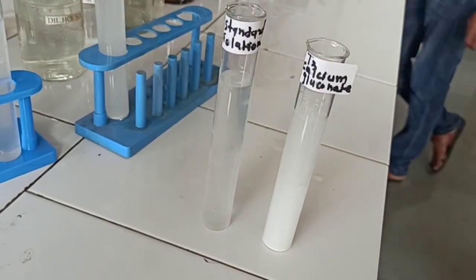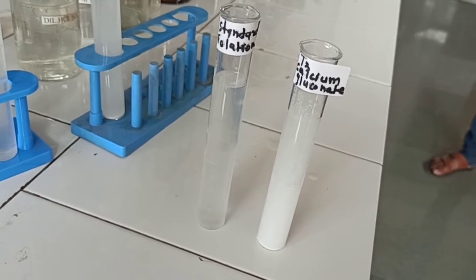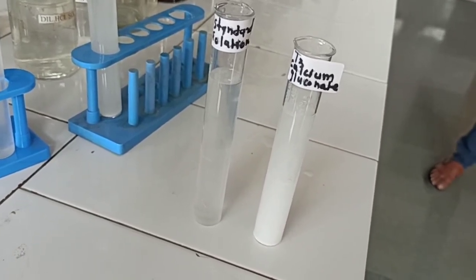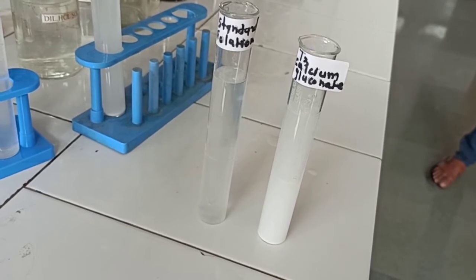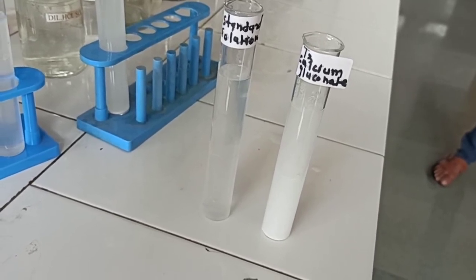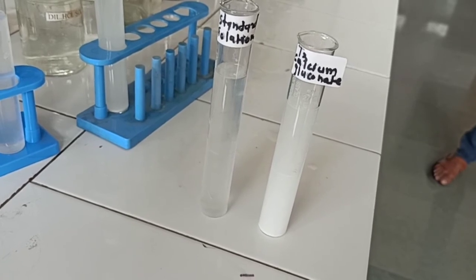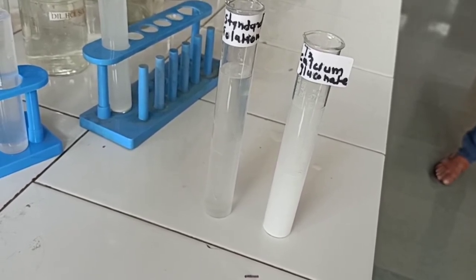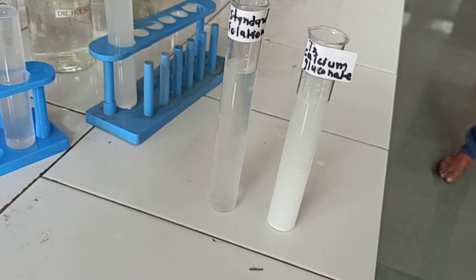When comparing the test solution of calcium gluconate with the standard, the opalescence produced by calcium gluconate is more than that of the standard solution. Therefore, the given sample of calcium gluconate does not comply with the limit test for sulfate as per IP.